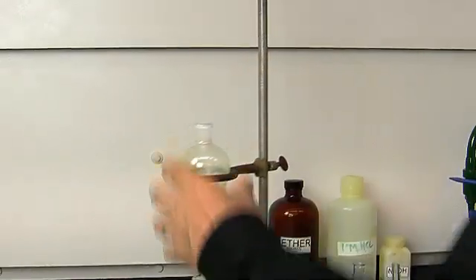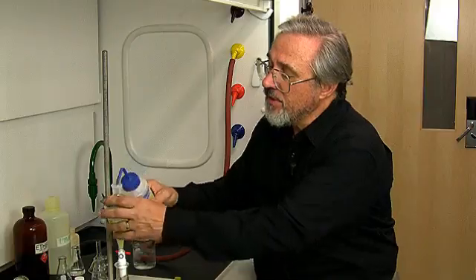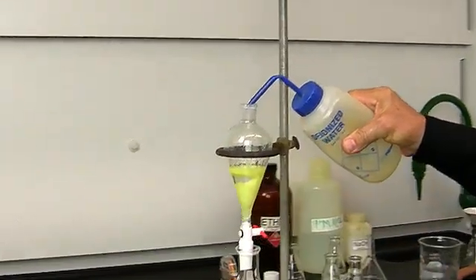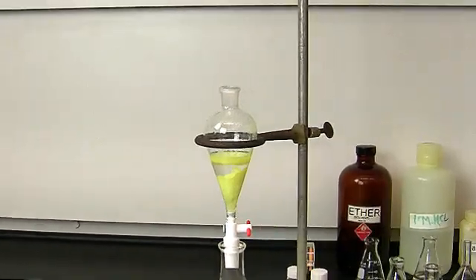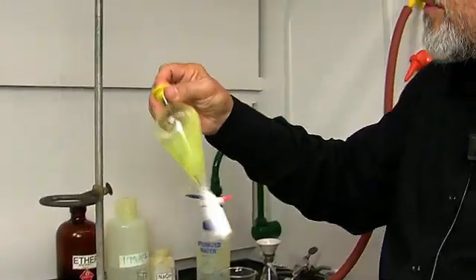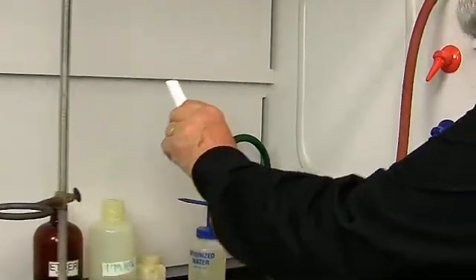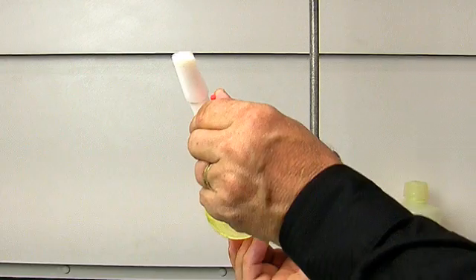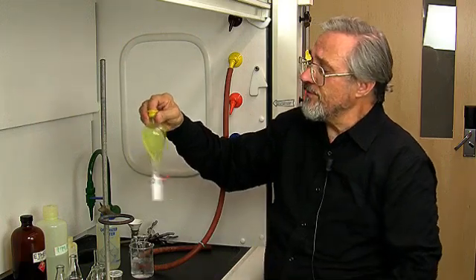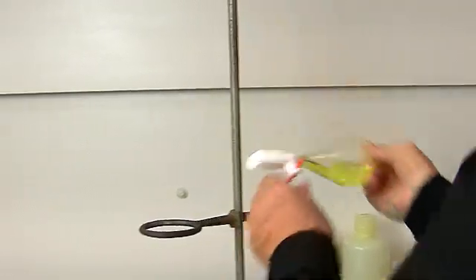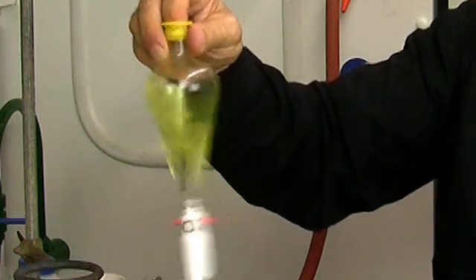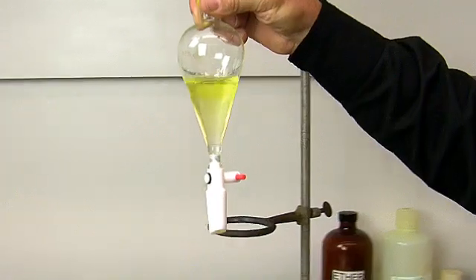Now I'm going to add a little bit of water in here so that we can dissolve the solid which forms. Okay, there we go. We swirl that around, and we also vent it. Now listen, you hear that? That's diethyl ether evaporating in the separatory funnel, and you've got to vent it often, because if you don't, the top on the separatory funnel will literally fly off. Okay, so there we go.